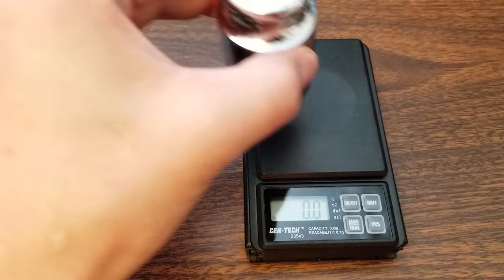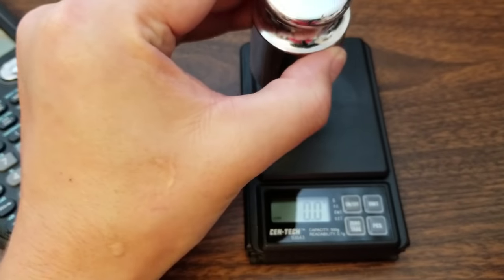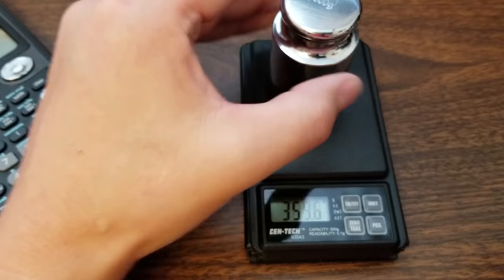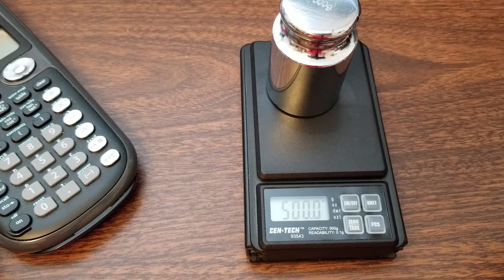But we can check. We'll put our 500 gram weight again. And we have 500 grams.